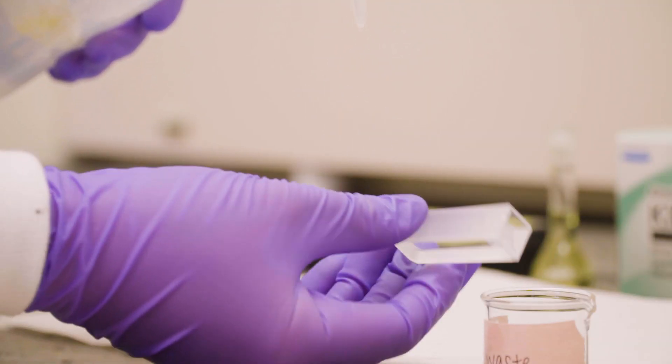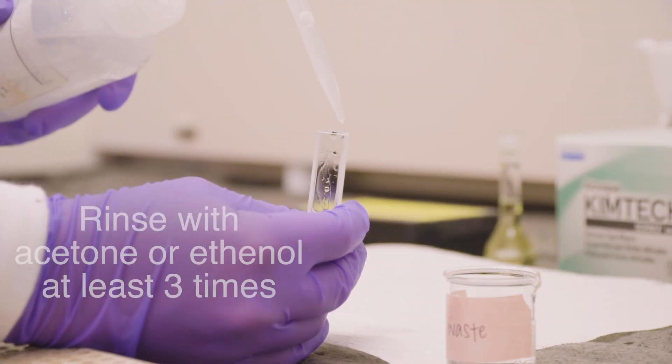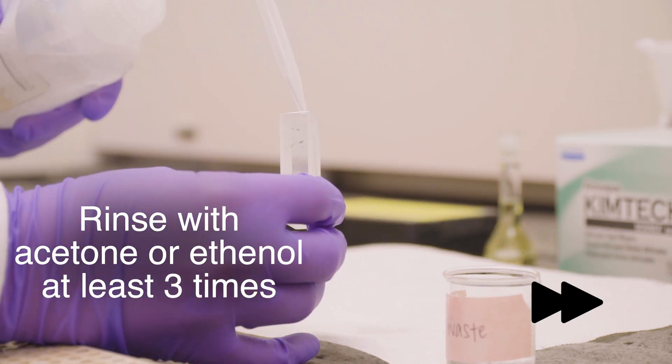Next, rinse the cuvette with either acetone or ethanol. This step helps to eliminate any residual impurities that may be present.